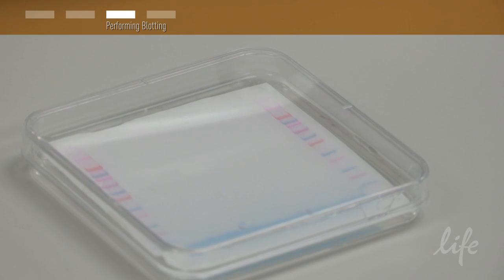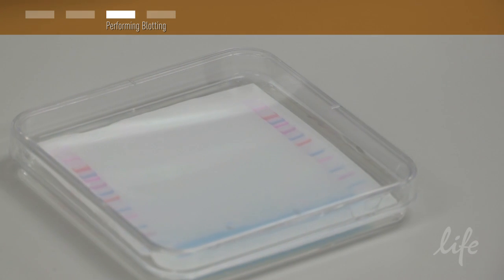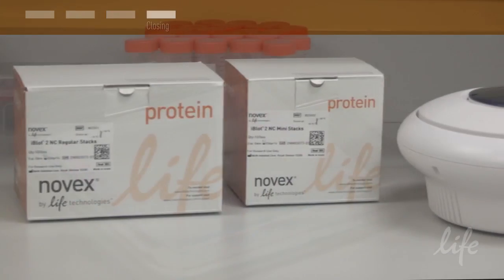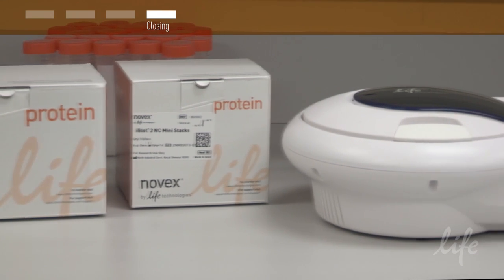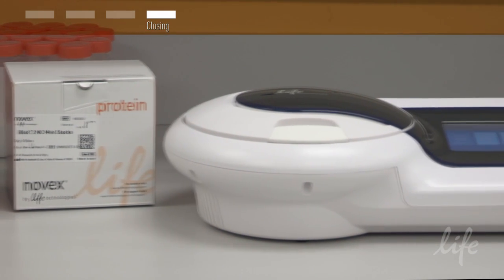Your membrane is now ready for immuno detection. For the new and improved seven minute dry blotting procedure, try the iBlot2 dry blotting system.